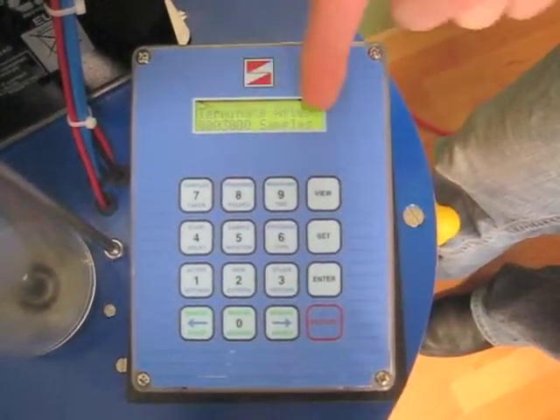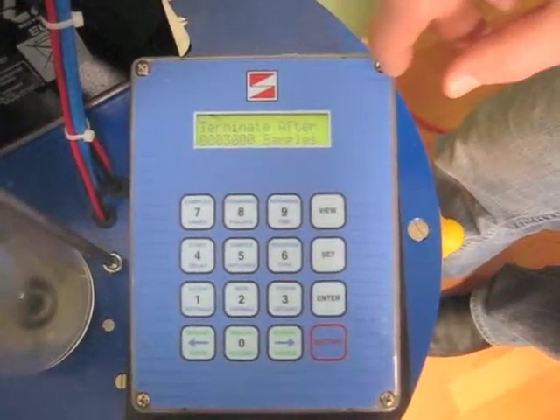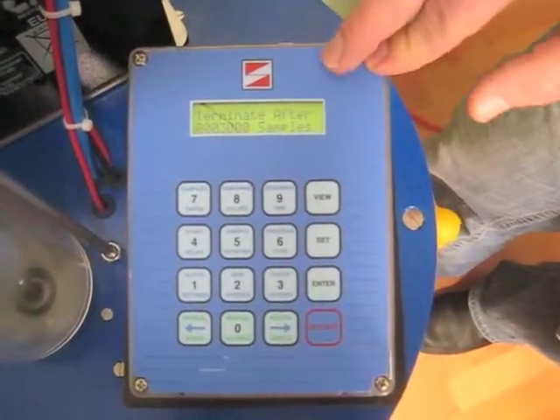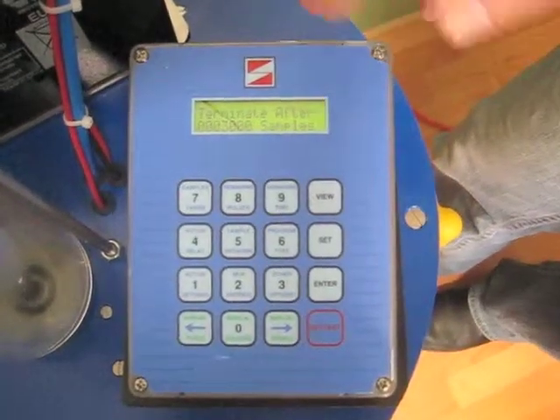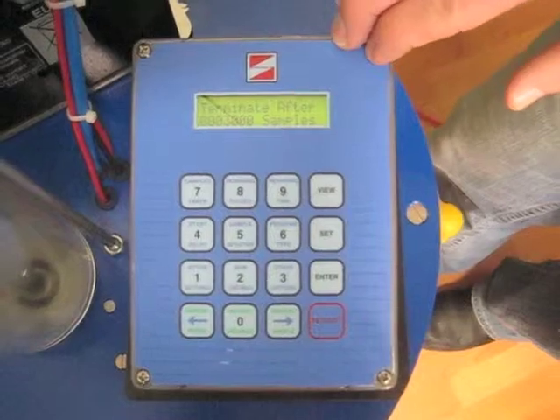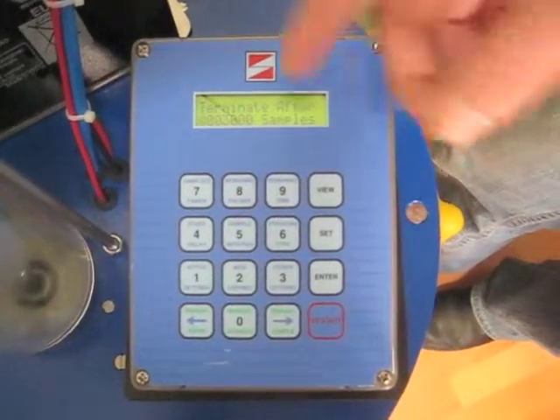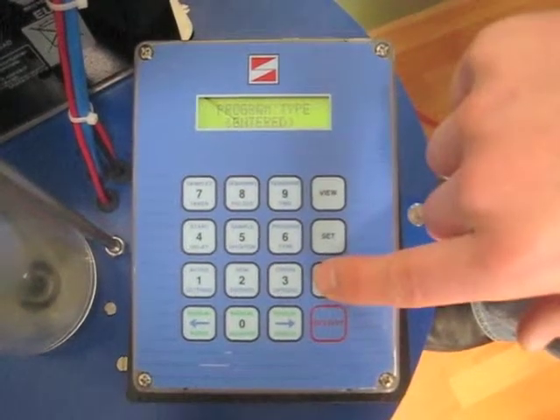Terminate after 3,000 samples. That's a lot in this case. The container in this particular sampler is only 2 gallons. So 3,000 samples will be too many. Basically it's saying keep sampling until it overflows. But you set here how many samples you want to go toward.